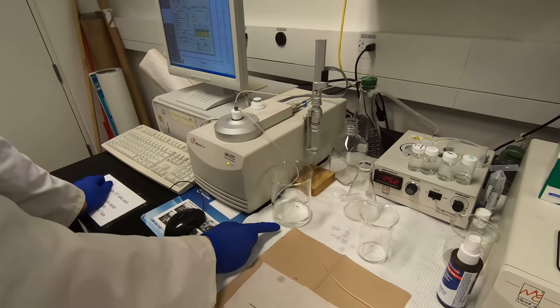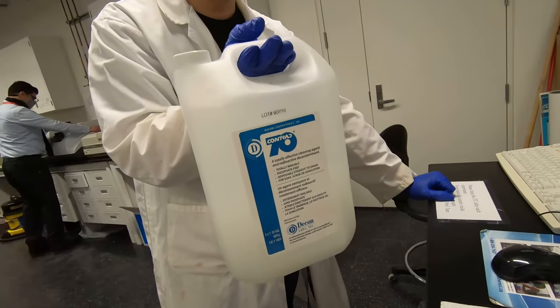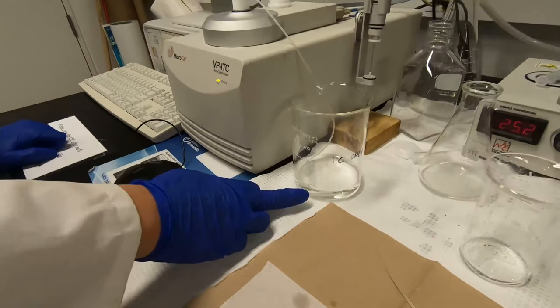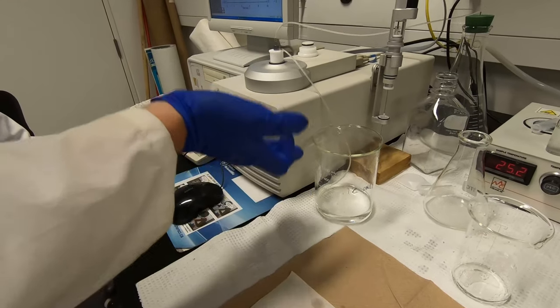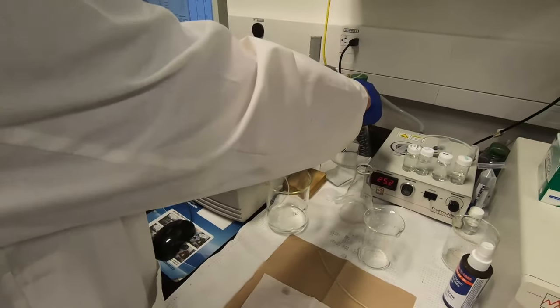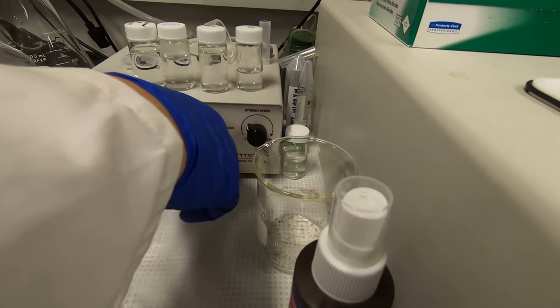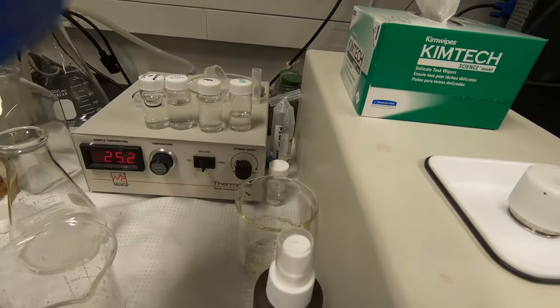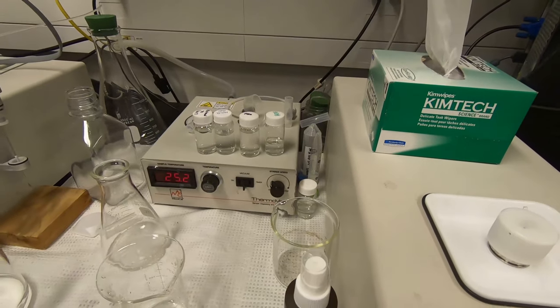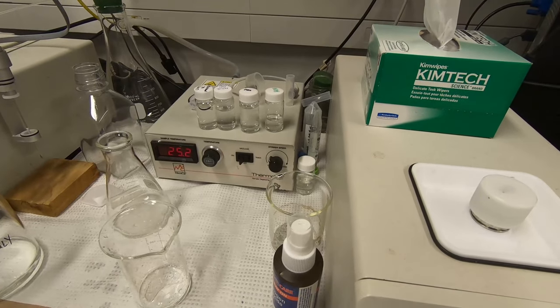This solution is what you use to clean the cell. Usually we clean first with a surfactant solution — like 10 to 20% surfactant solution. Now I'll just put some milli-Q water to flush the sample cell. Everything is connected: water to sample cell and to the waste flask. Push the vacuum pump to the right side — one time is to turn it on for around five minutes, and it will stop after five minutes. If you want it to keep running, push it to the left as well.